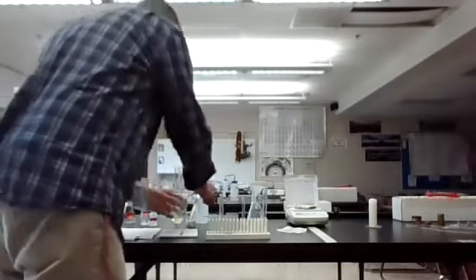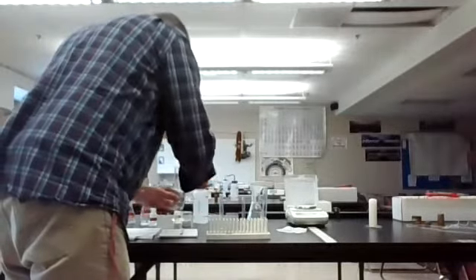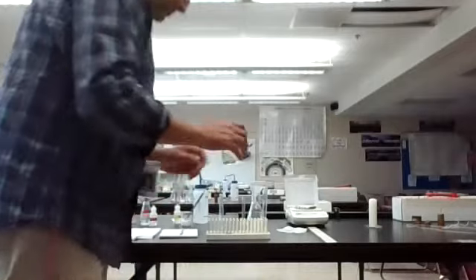I could put a touch more salt in here. Pour these out.